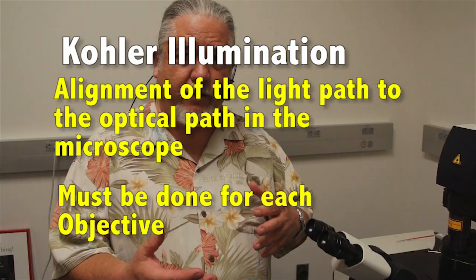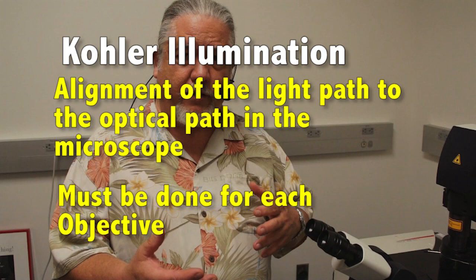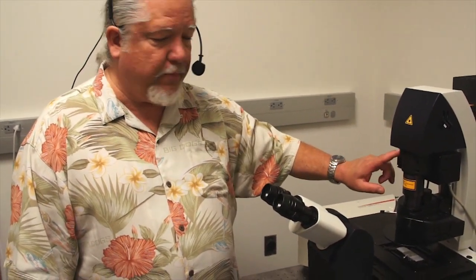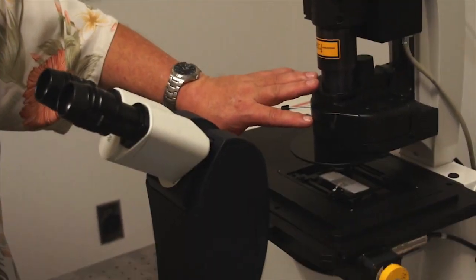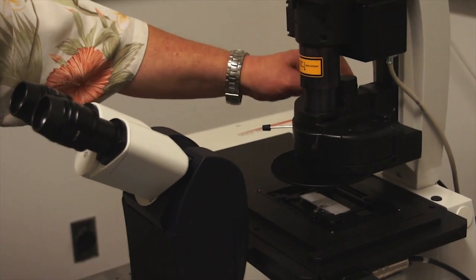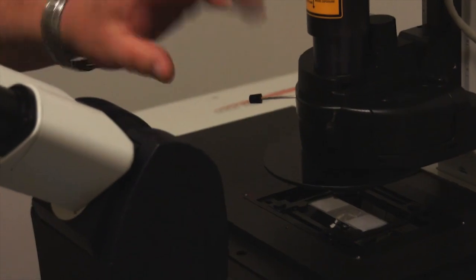As mentioned previously, Köhler illumination — the alignment of the light path to the optical path in the microscope — is very important. You must do it for each objective that you're working with. To do this, we're going to use features of the illuminator: we're going to manipulate the field diaphragm, manipulate the height of the condenser by turning the knob up and down, and use two alignment tools to align the condenser to the optical path.